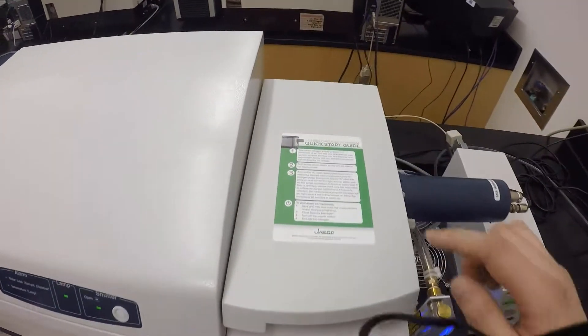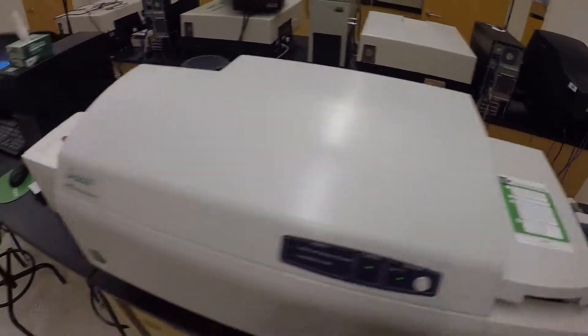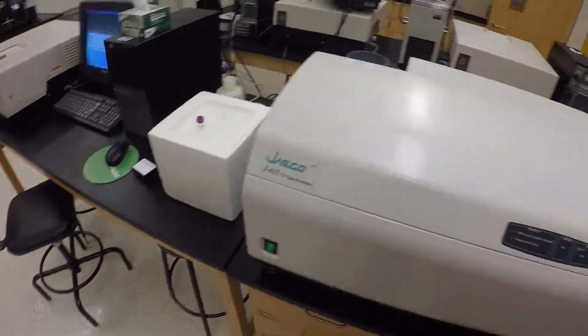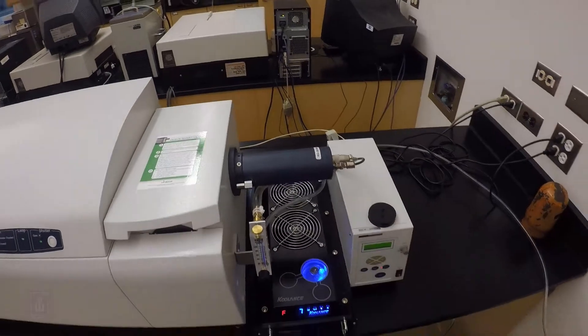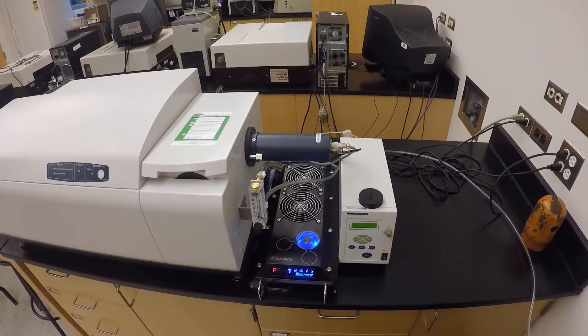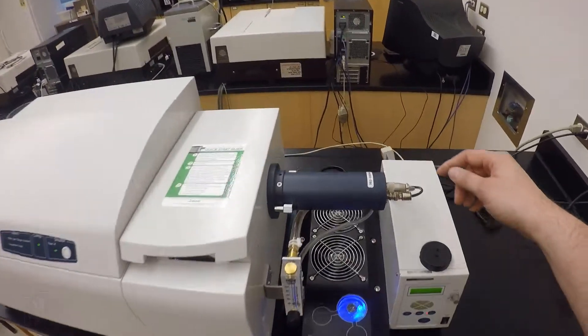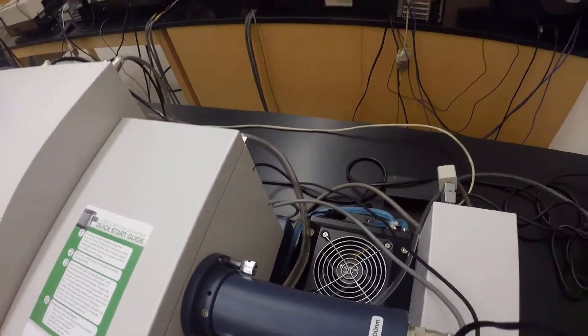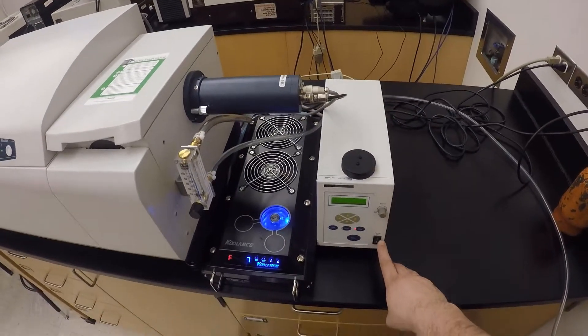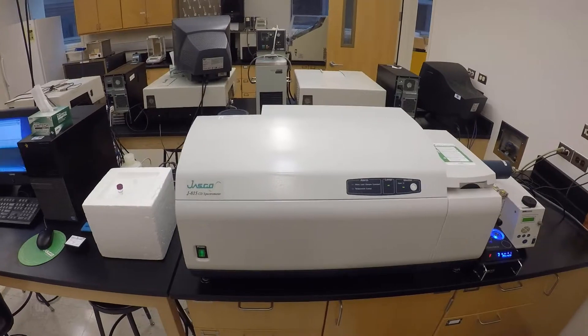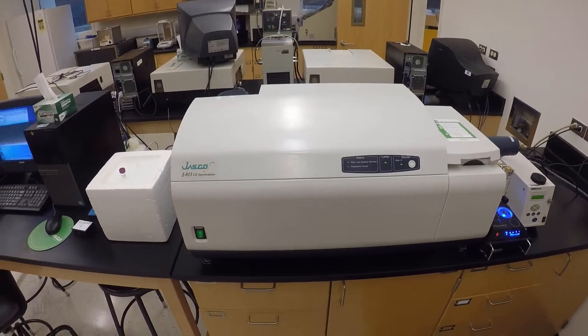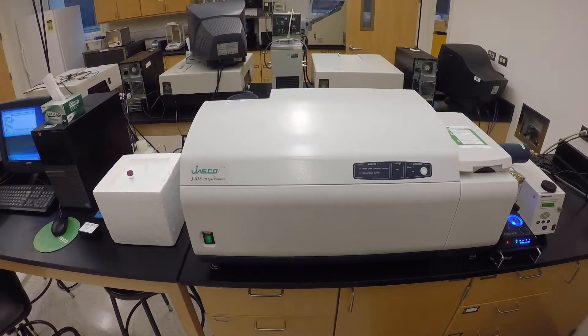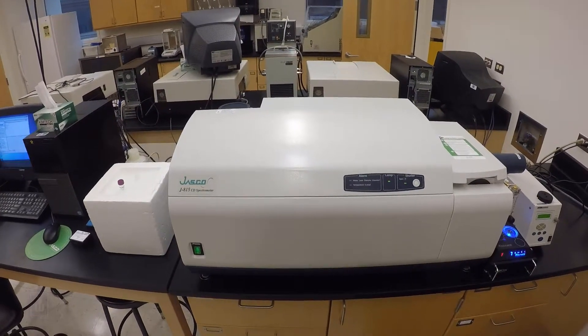Most of the instructions for startup are here on the top of the instrument: turn on the nitrogen, turn on the power switch. I already have that warming up today, and then turn on the temperature controllers if you're going to do a thermal experiment like a thermal melt which we'll do today as well. So to turn that on, you just have to switch this switch here to on, and then I'll also turn on the power on the thermal controller. There's only a few switches to get this thing going, and then just let it warm up for a little while.